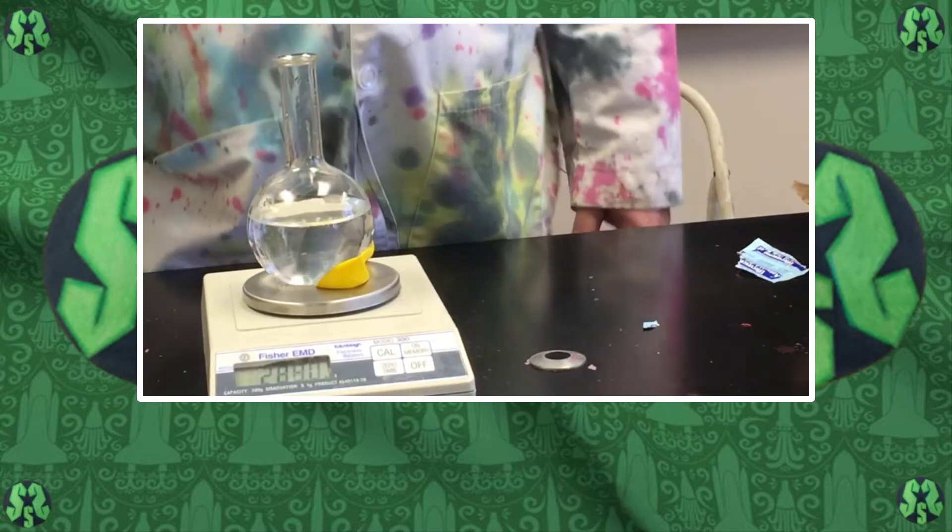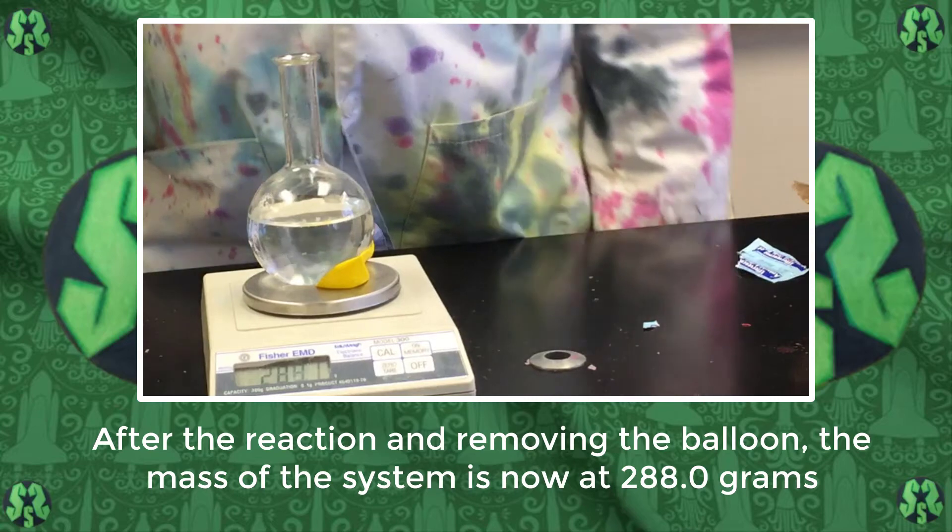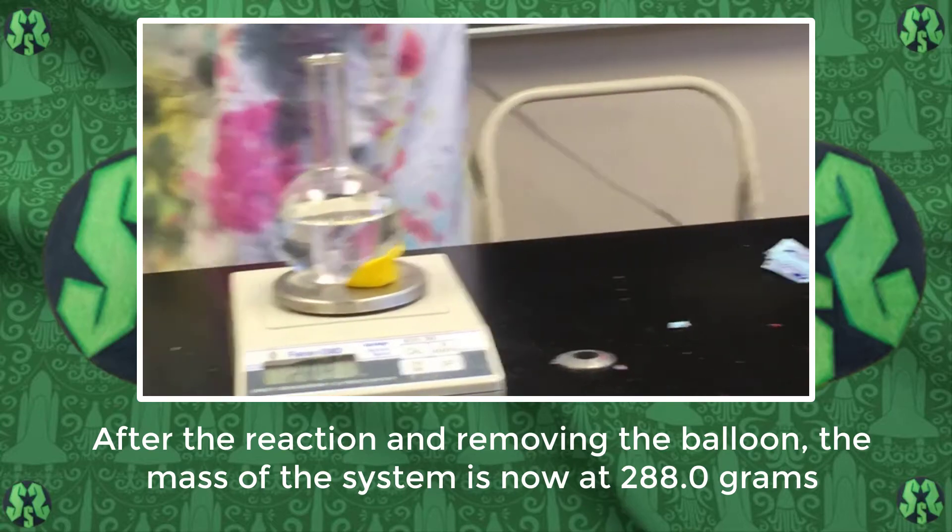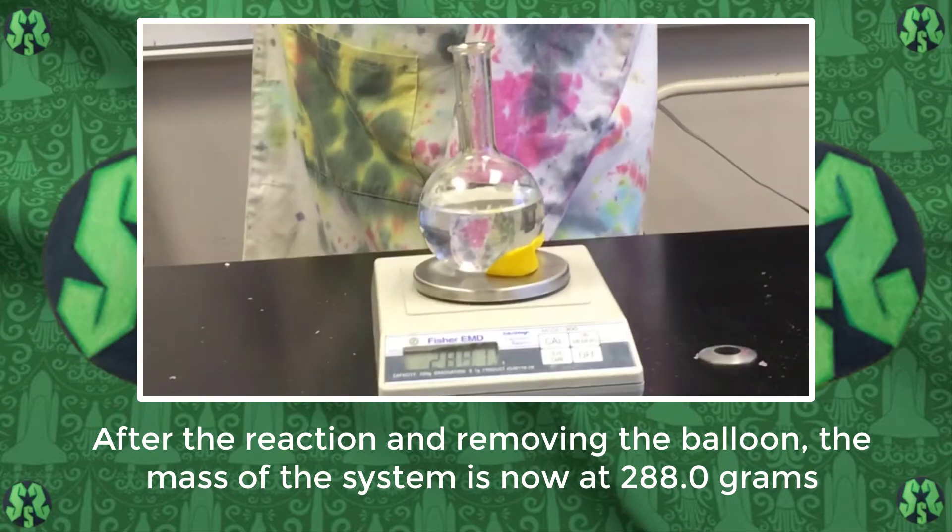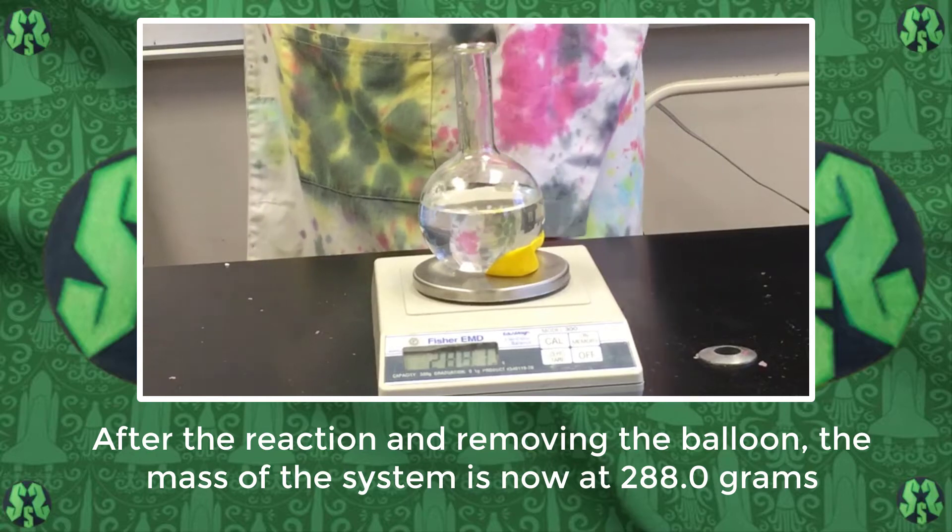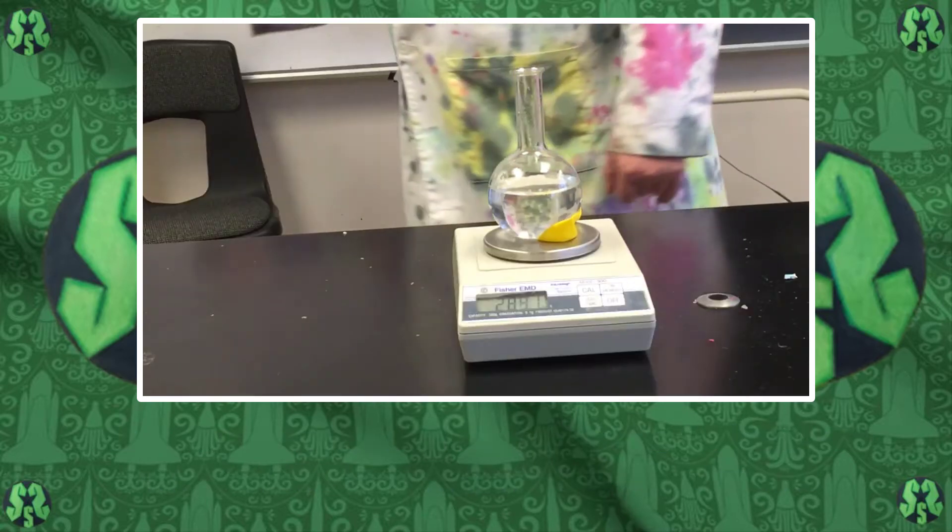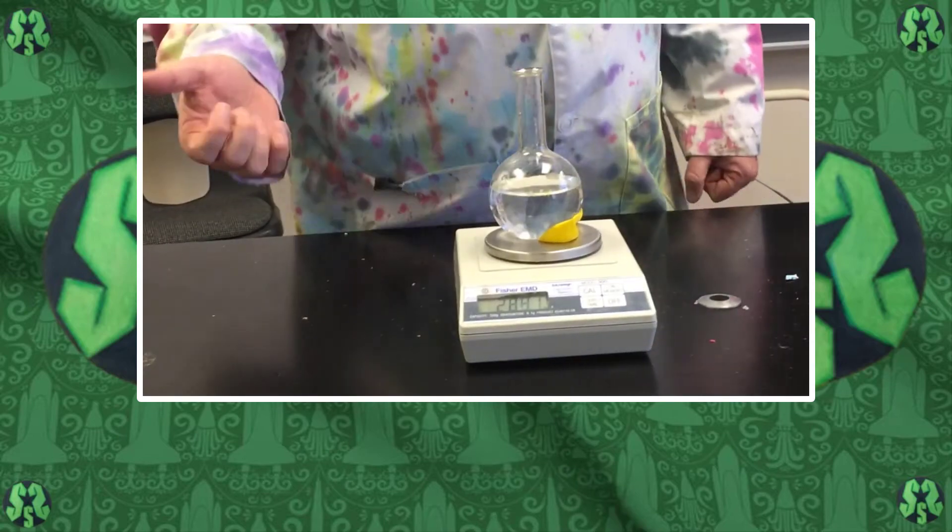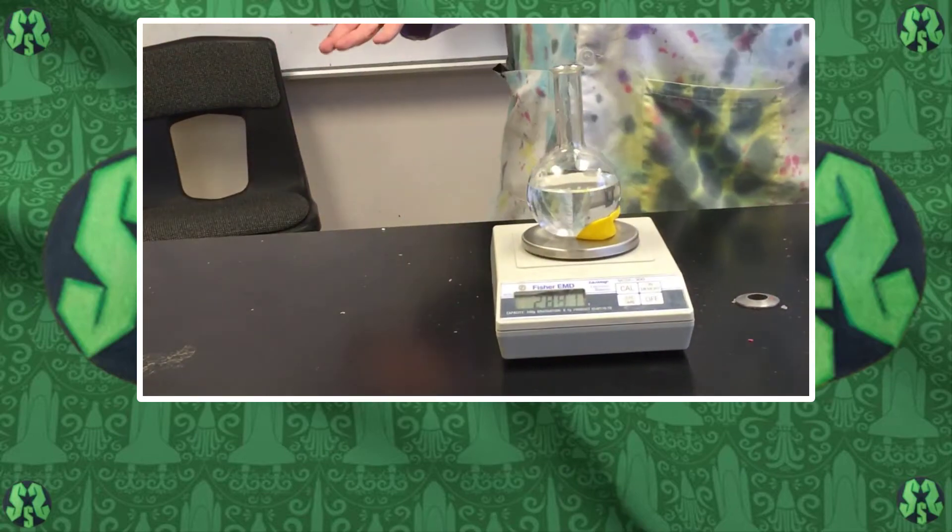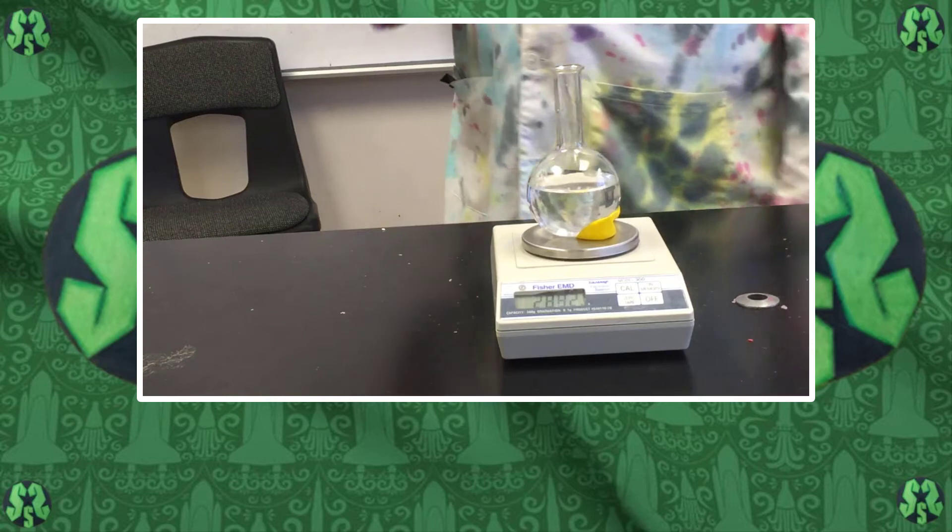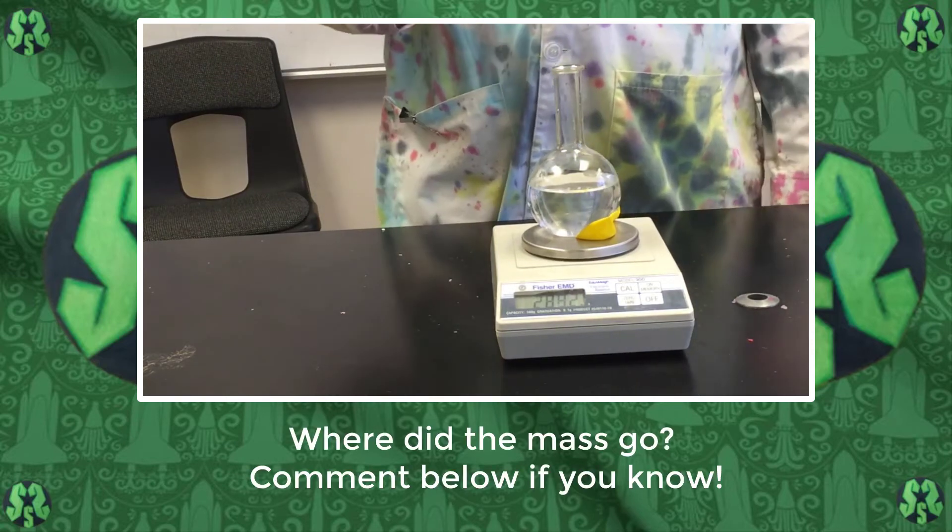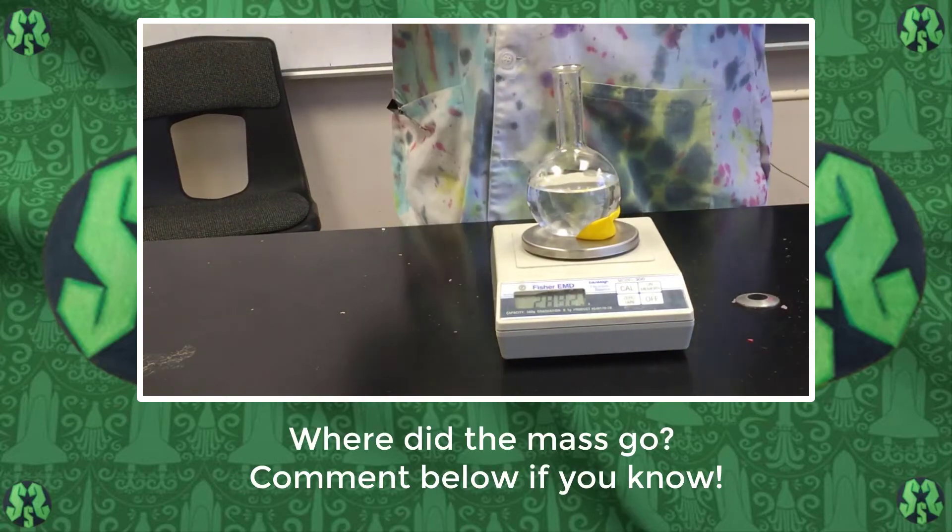We've let it sit for about 10 minutes now and it is down to 288 grams. So we started at 288.9, we're now at 288 grams, so we have lost nine-tenths of a gram. We're going to let this sit for a little bit longer. Where is that mass going? That's something you could be thinking about - where did the mass go?